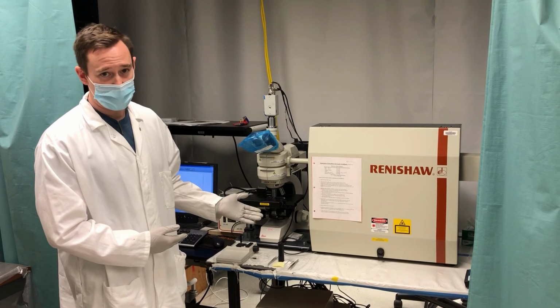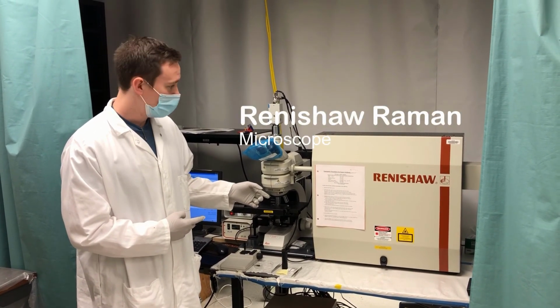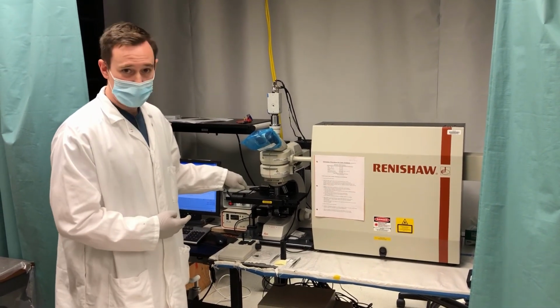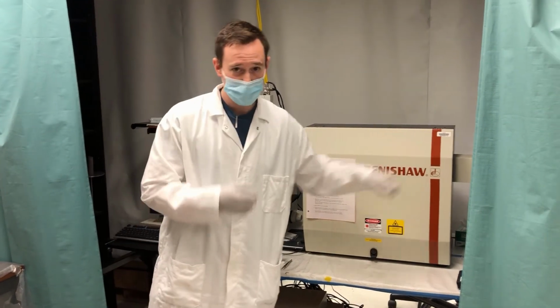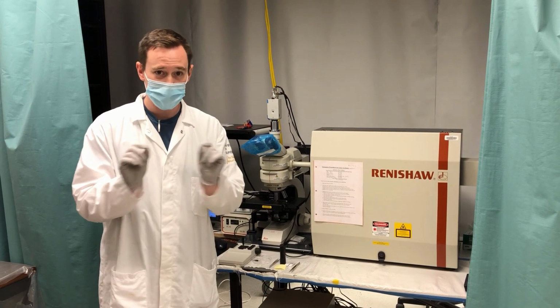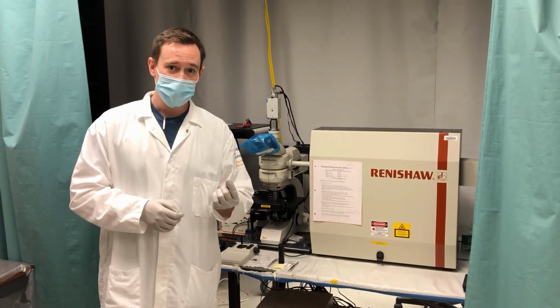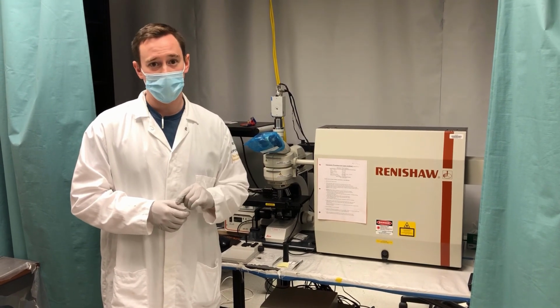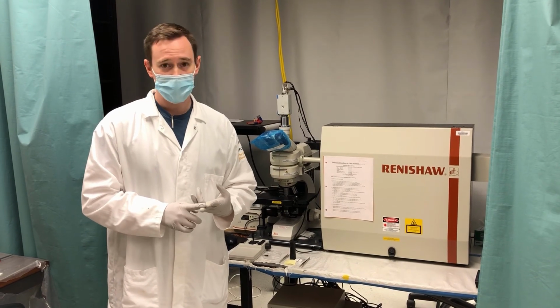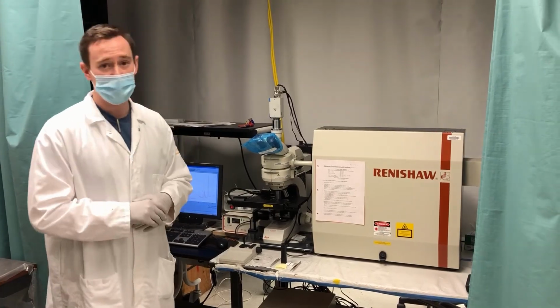As you can see here, this is a Raman Microscope. It uses a monochromatic 785 nanometer laser, and it goes through an assortment of filters that ultimately goes down to a sample and goes to a detector. And what it's measuring is the phonon or vibrational modes of solid state materials. Basically a vibrational fingerprint for identifying different types of materials such as pharmaceuticals, novel 2D materials, biological materials, basically almost anything you can think of.